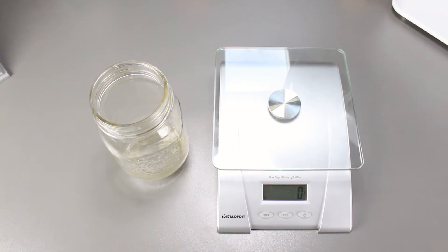I wonder if the bacteria actually did anything this week. Nope — it's still 8 grams.